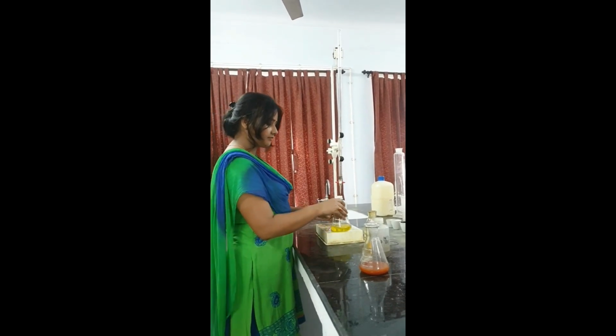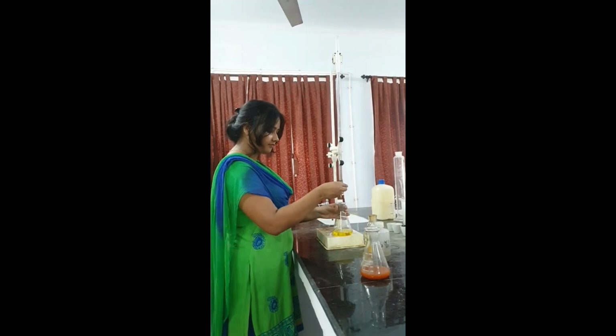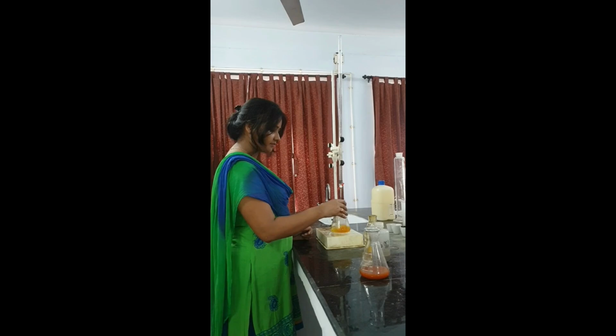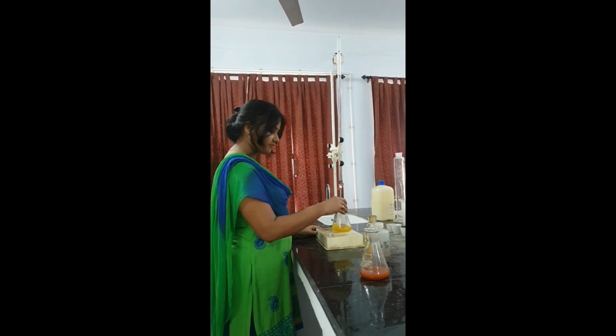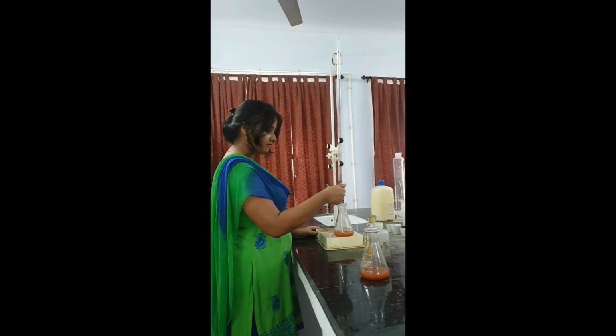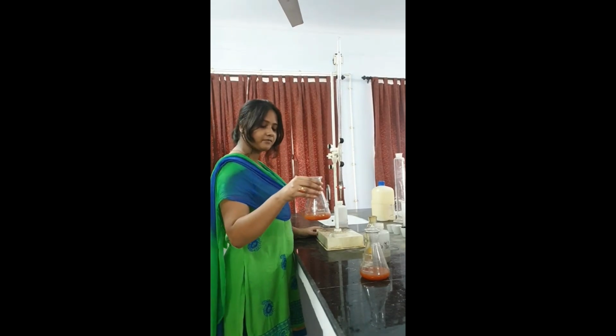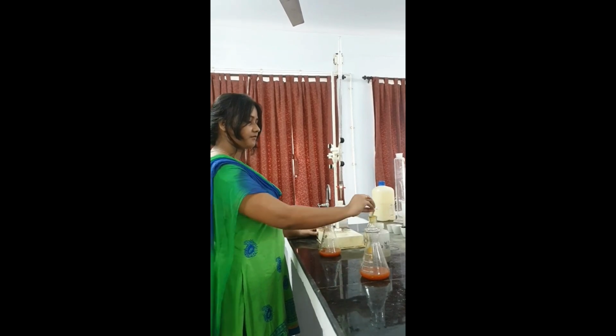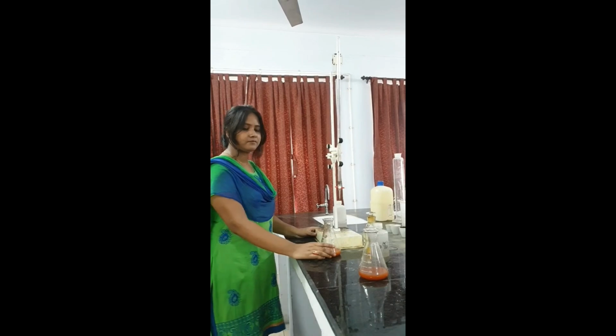Now we will begin the titration for the blank, the distilled water, also. Initial volume has been noted down. Okay, start. Just a small movement has to be given and you will see that it will again turn into brick red color. For the blank also, brick red color will develop. So see, the color is being developed. Perfect, we have achieved it. This is the brick red color. Once show it in front of the camera. This is the brick red color, yellow to brick red. So our entire process has been depicted in this video, from yellow color to brick red color.